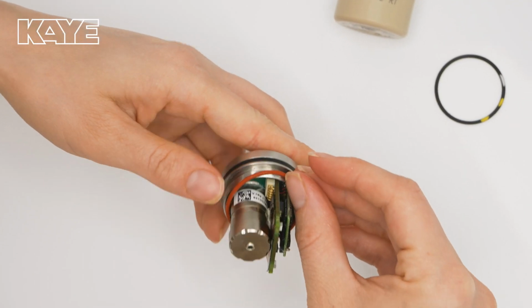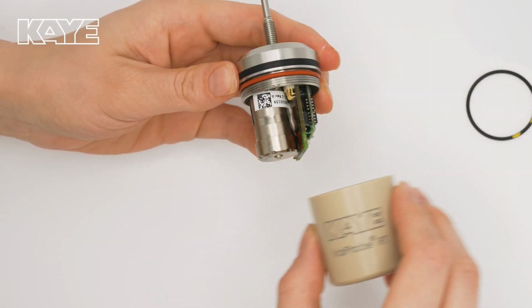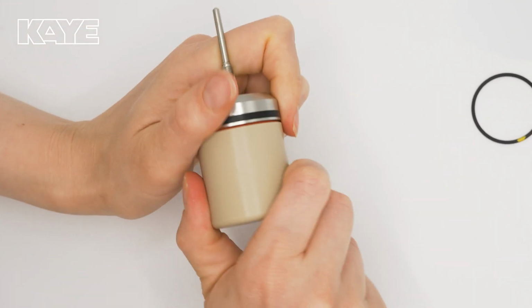Then slide the new O-ring onto the ValProbe, ensuring that it's seated at the very top of the threads. Finally, twist on the housing unit, making sure it's snug and the O-ring is no longer visible. Always hand tighten. You don't need any tools to do this process.